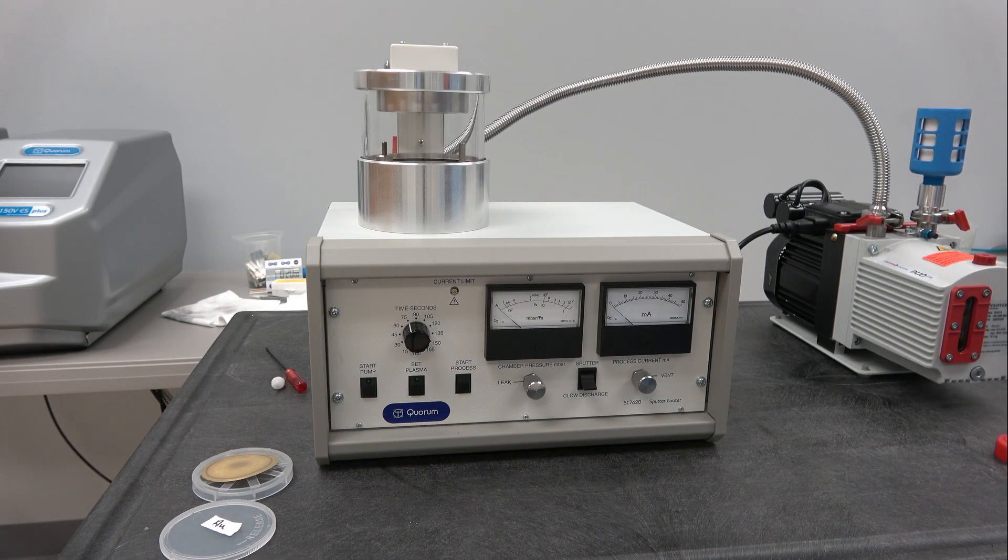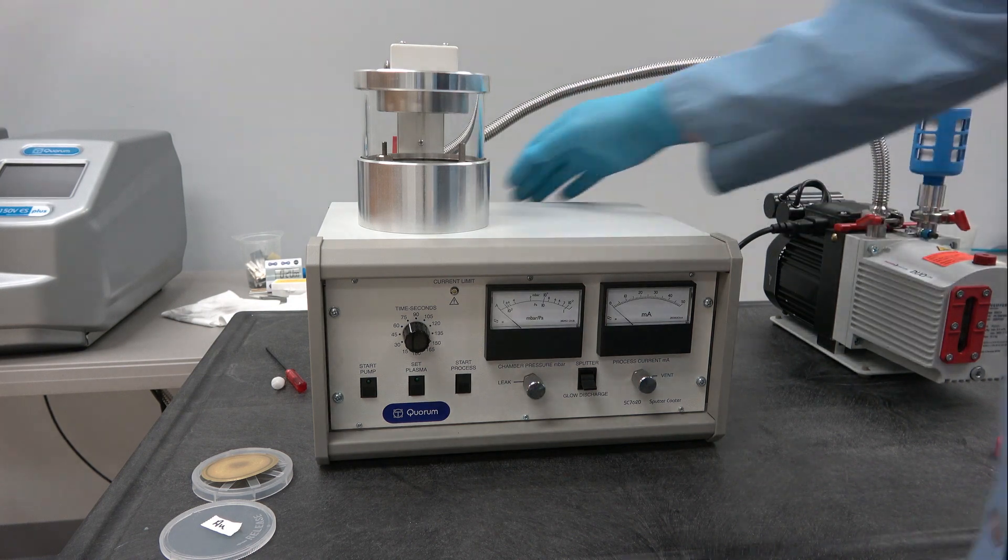So the target's installed, we have argon gas, the rotary pump is connected. So now we'll power it on.